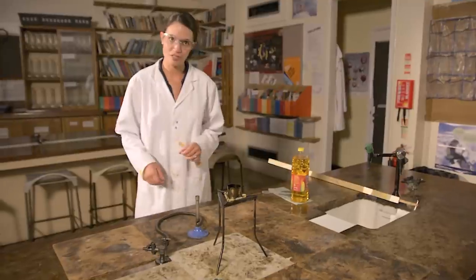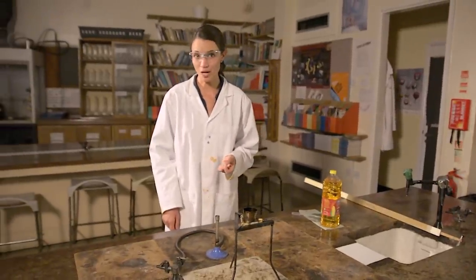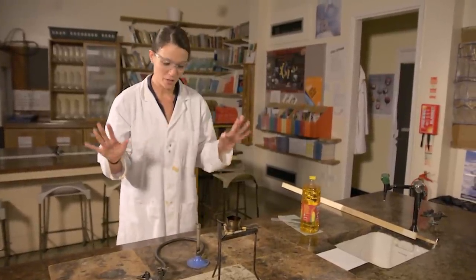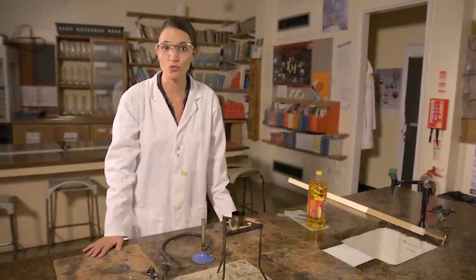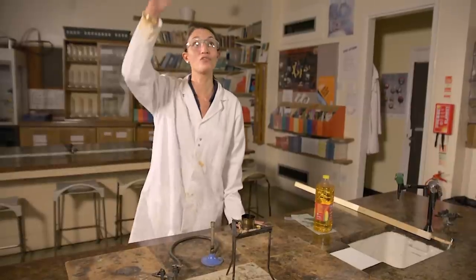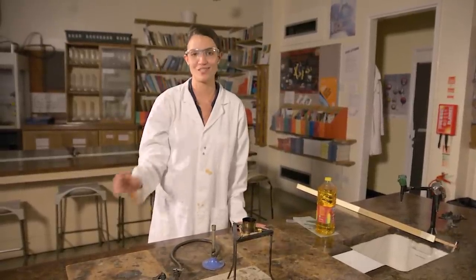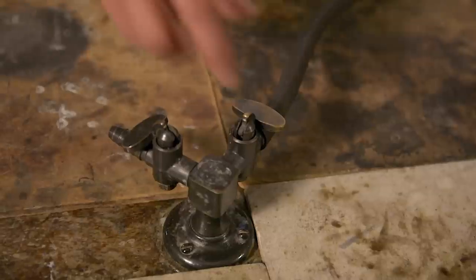You might think it's safe to do this demonstration inside a fume cupboard, but in actual fact the flames are too high. It's perfectly safe to do the demonstration on a normal lab bench as long as you've got a good few meters of head clearance and make sure you're not under any light fittings or ceiling decorations.